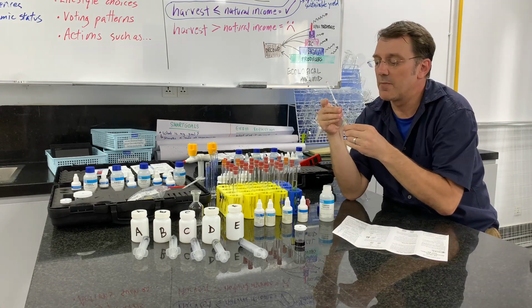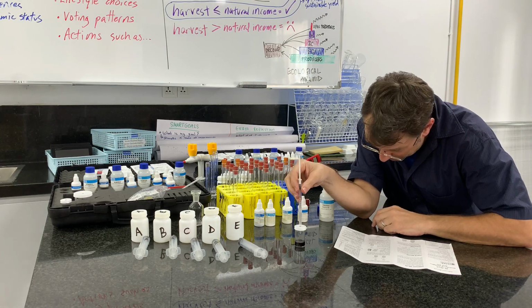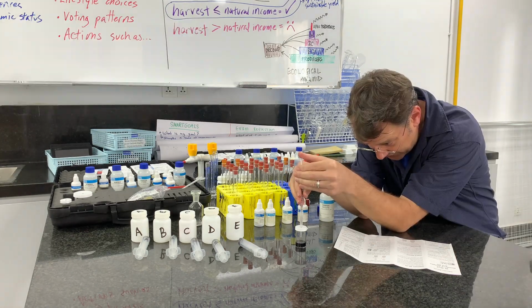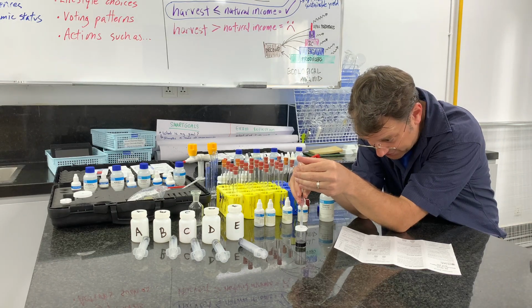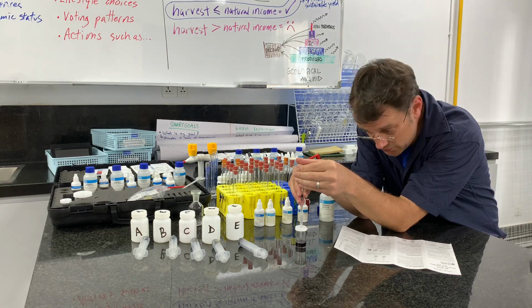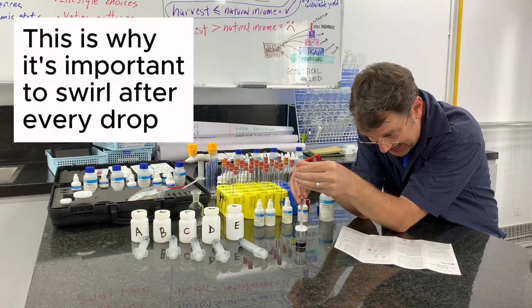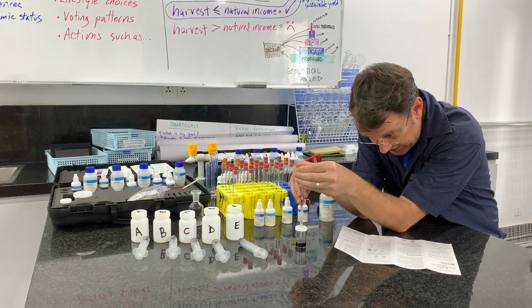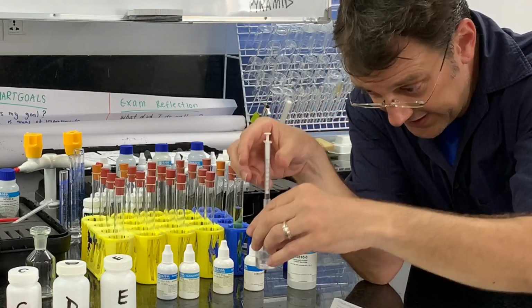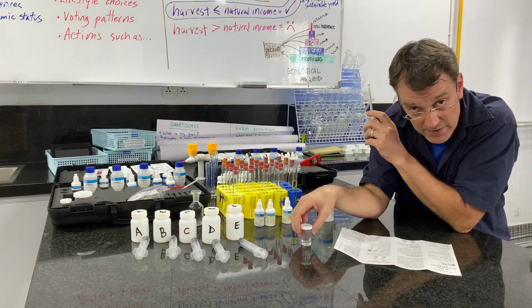Now, I've added my special little airtight tip, and what I'm going to do is go drop by drop, and I'm going to titrate it. And as soon as this dark purple liquid goes colorless, I'm going to stop adding this titrant solution. And usually what will happen is you'll get 1 or 2 drops where it temporarily goes colorless, or the color becomes a little bit paler. And when that is the case, you're very close to that endpoint. My solution is completely colorless. It's colorless. I've swirled after each drop to make sure that it's well mixed, right?